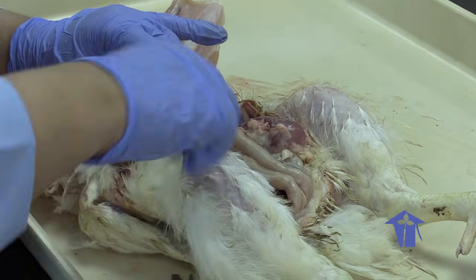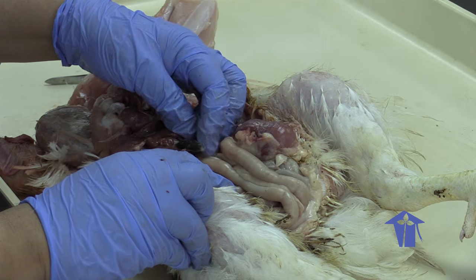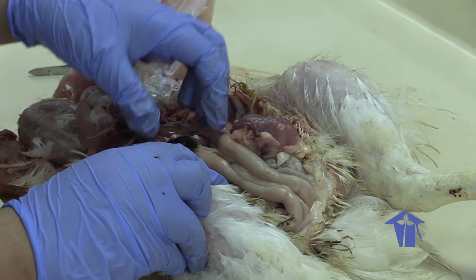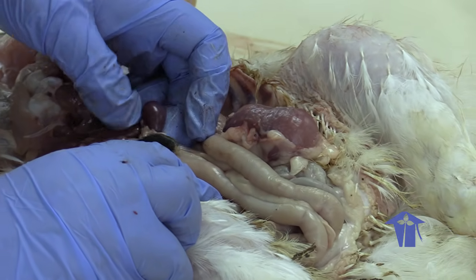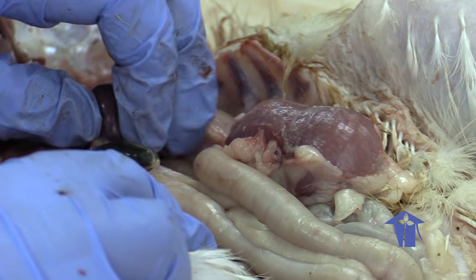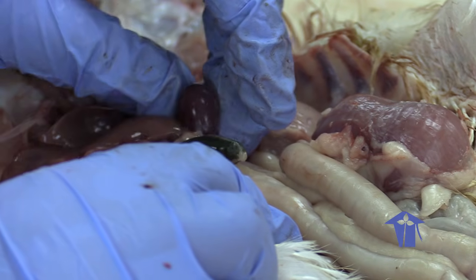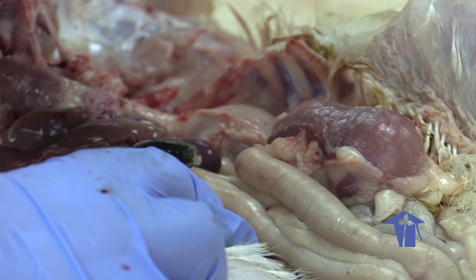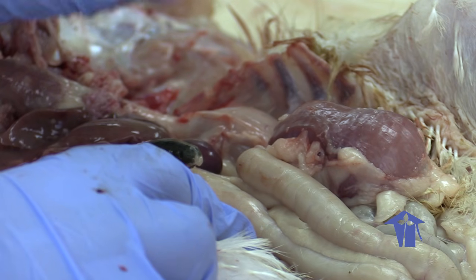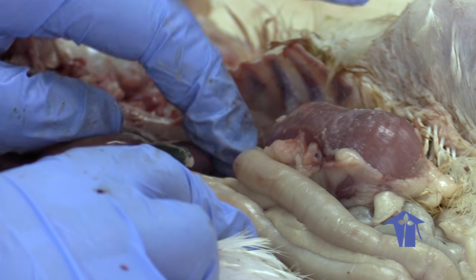Okay, so we have our liver, we have our gallbladder, which is green, right? So the gallbladder is all about storing that bile to break down, to emulsify the fat, right? And to change the pH from the stomach into the intestine. What is the pH of the stomach? You remember the pH of the stomach is always acidic. The small intestine is an alkaline environment. So secretions from the liver and secretions from the pancreas are going to neutralize the acid of the stomach contents to make it a more basic environment.